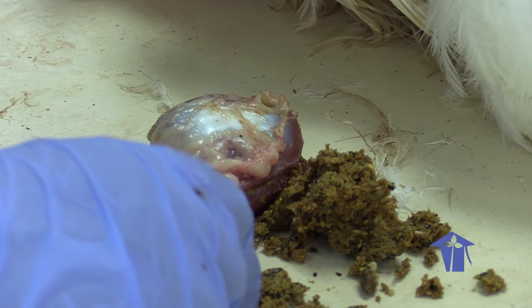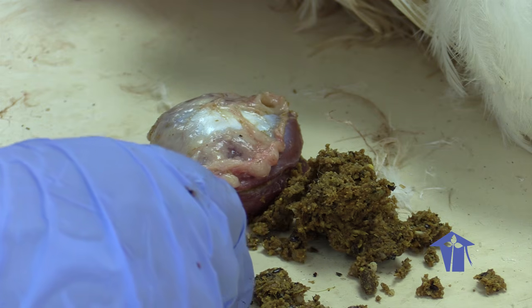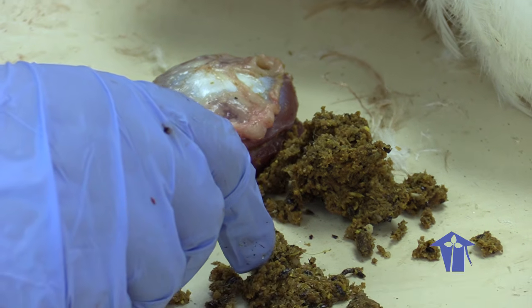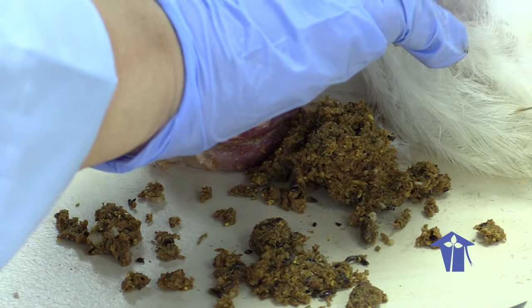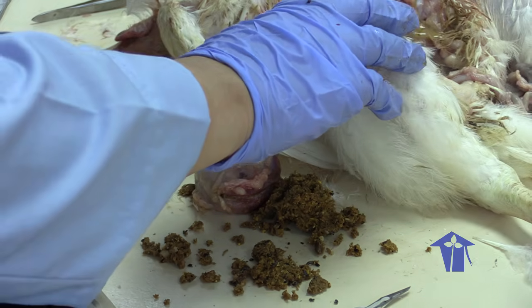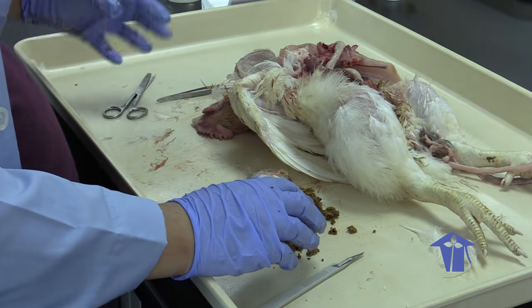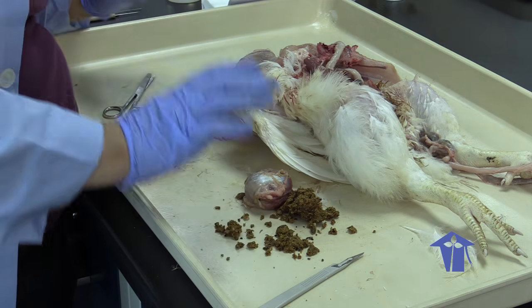I hope you enjoyed this because it really is interesting. When you can put aside the feelings of this is not fun, it's very interesting to see how the organs connect to each other and to know what their functions are. This is one of the reasons why I still do biology, I still do dissections, and I value dissections because it gives me a great appreciation of how things are connected and how they work together to function. And that's not something you can get from just reading a book. All right, so that's the end of the dissection of the chicken.